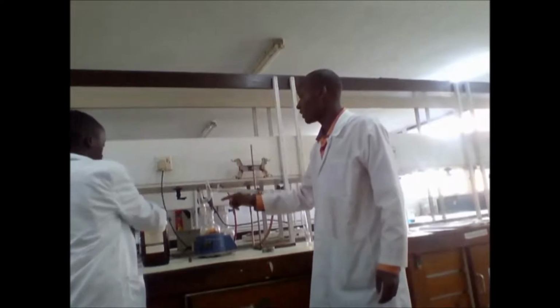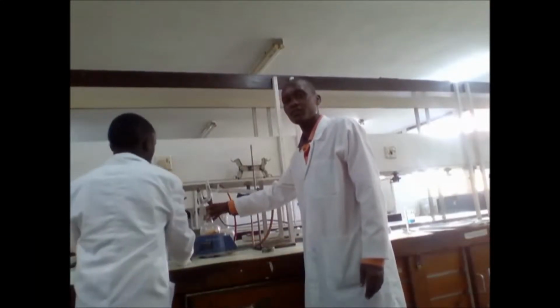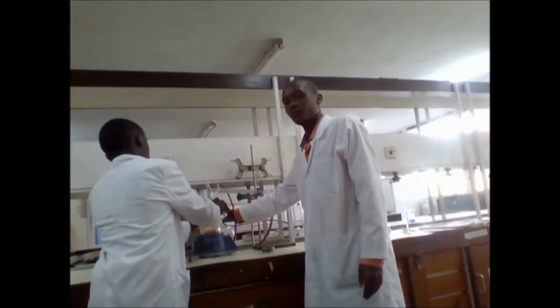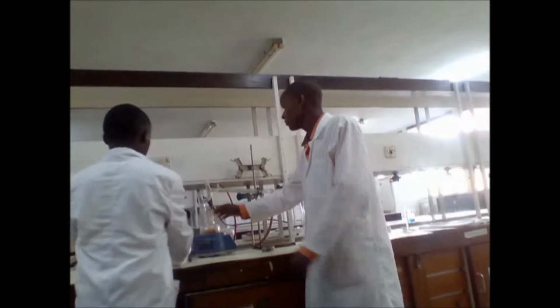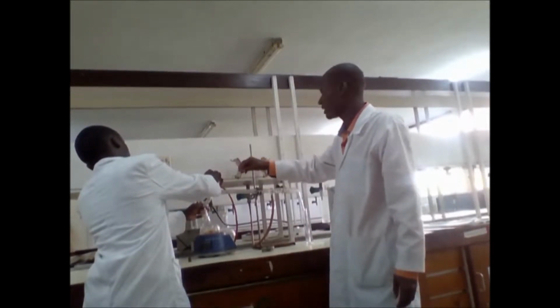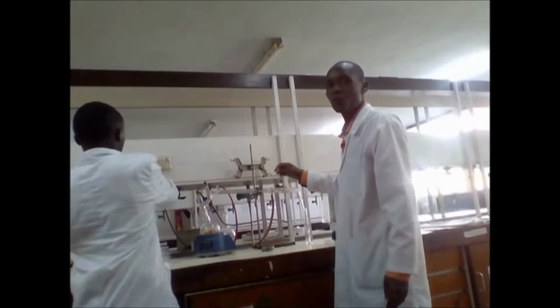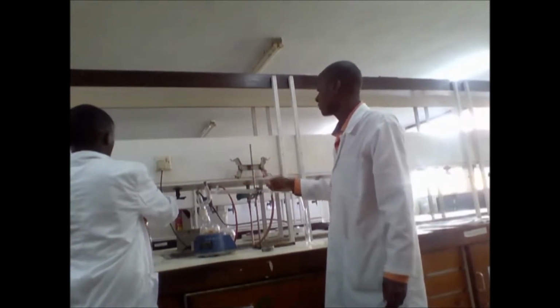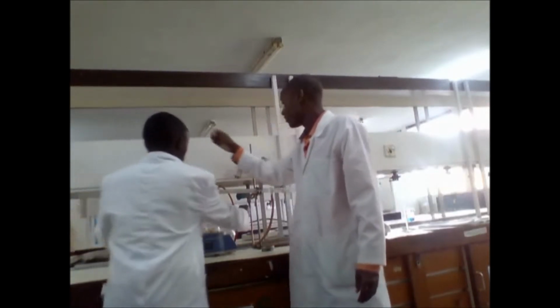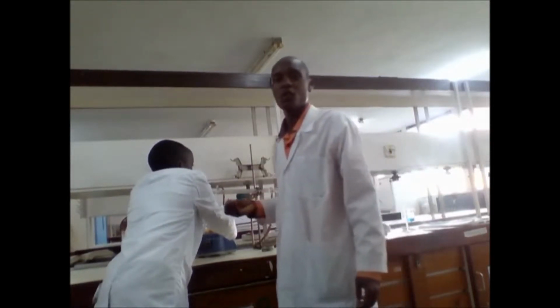You add the toluene, which is the organic solvent, into the food sample, just enough to completely cover it. Then you add some toluene through the top part of the condenser. Then you begin boiling slowly, and for some time you allow the distillation to take place at the rate of 2 drops per second. Then you increase the rate of distillation to about 4 drops per second.